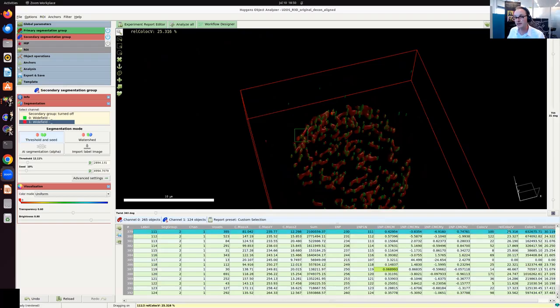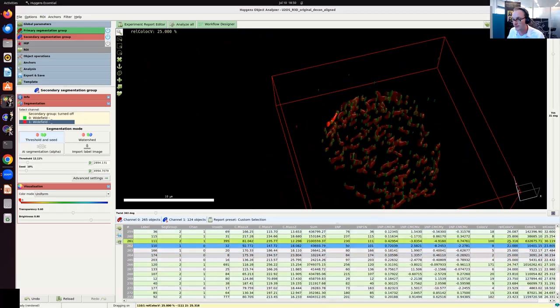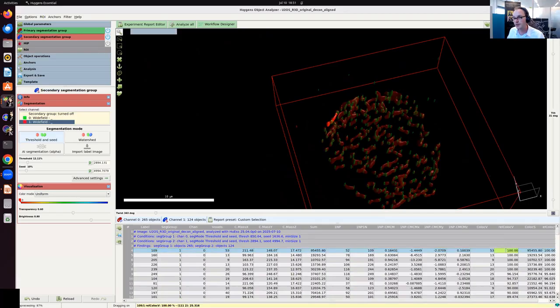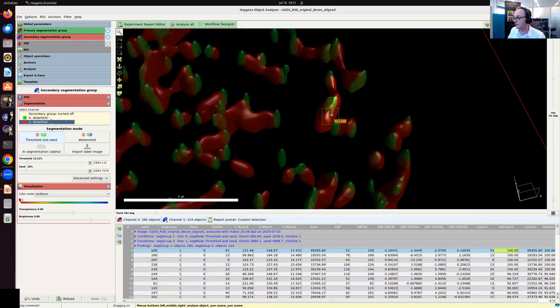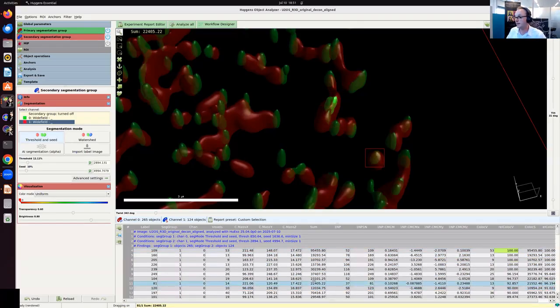And the other thing is that I can get the relative and also sort it decreasing. So decreasing, so it has the highest percentage on top. This is the percentage of the object that is co-localizing within the other channel. So these are just parameters as well as the object volume or the object sum intensity. And I have all this, and I can mine this data set to find patterns and draw my biological conclusions based on that. So that brings me to the end.